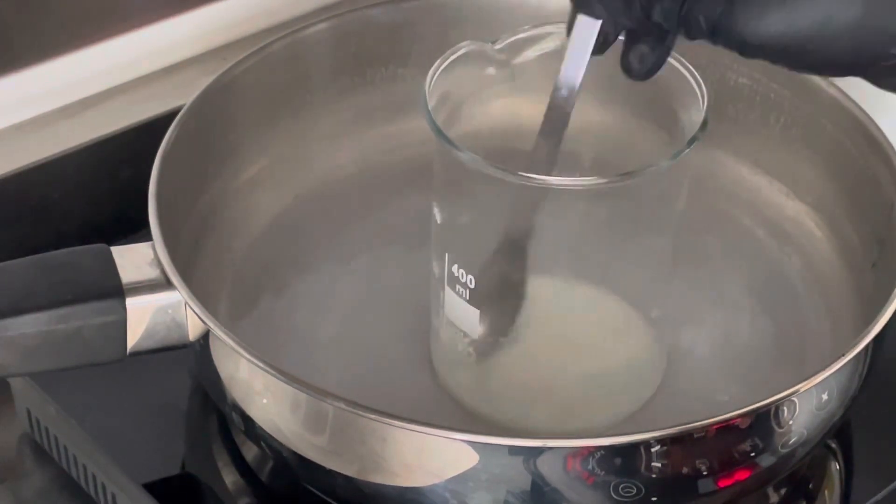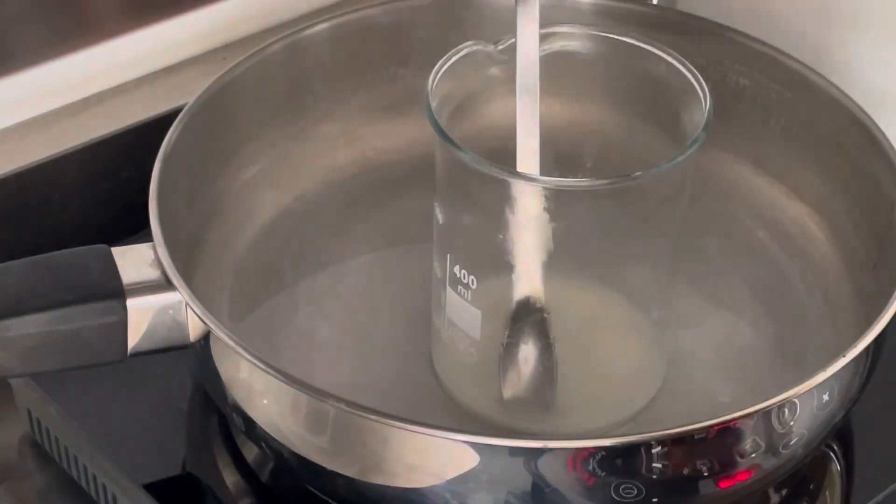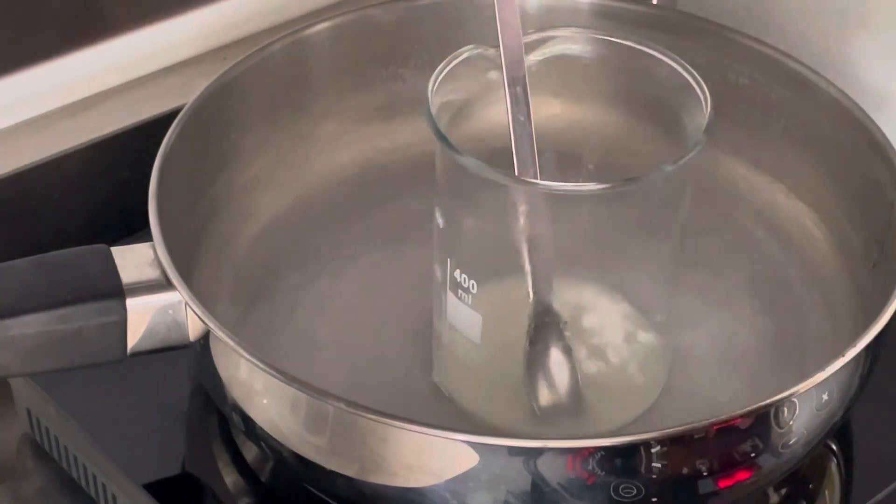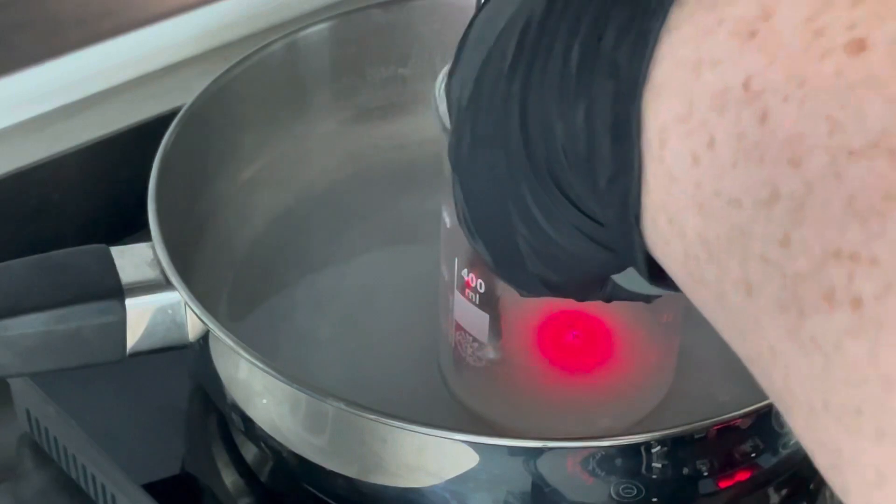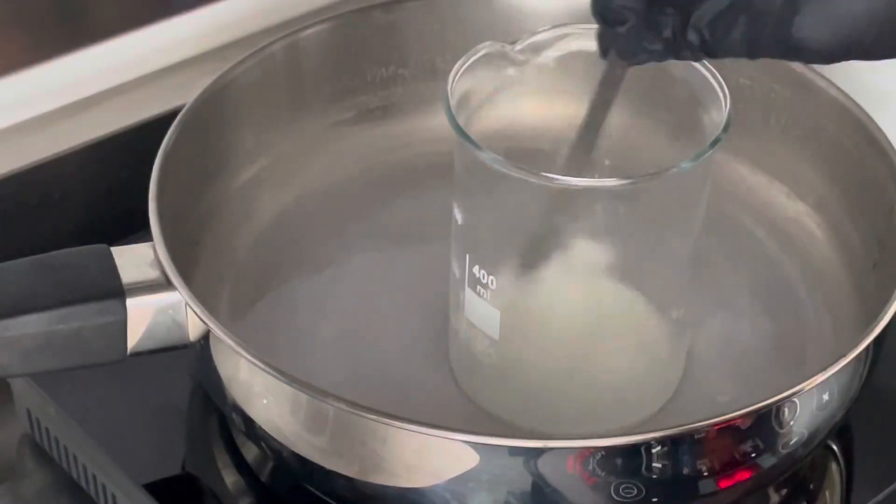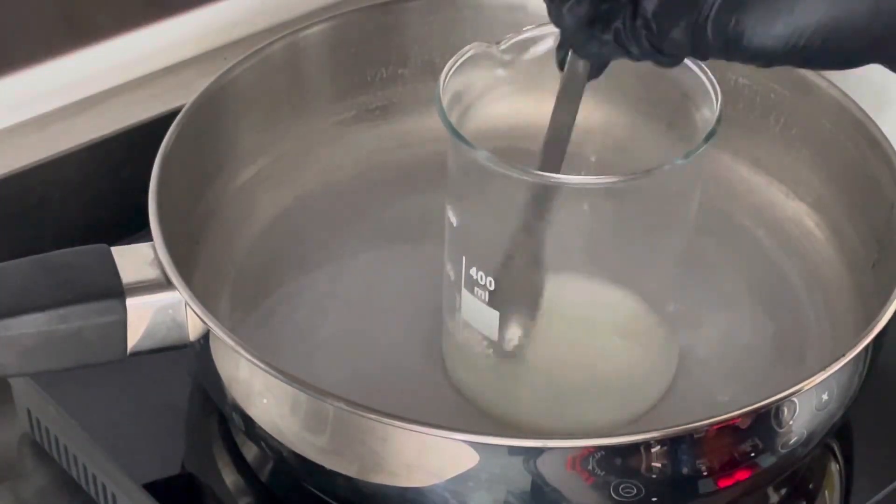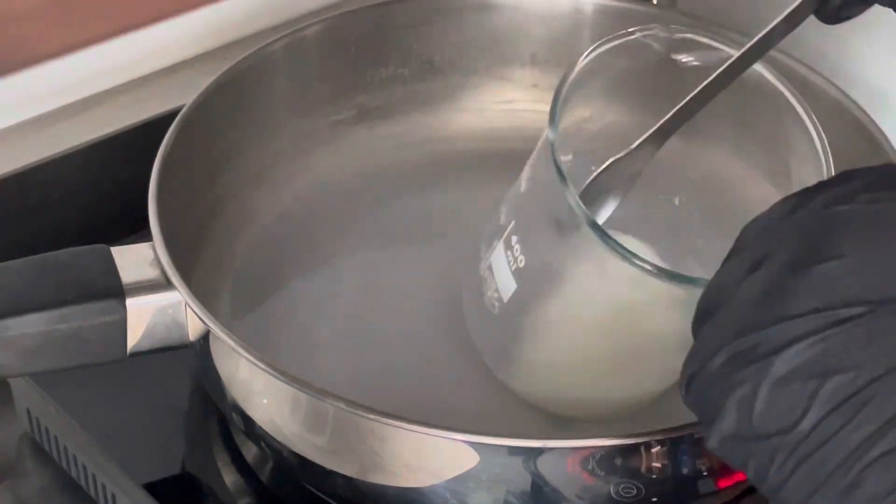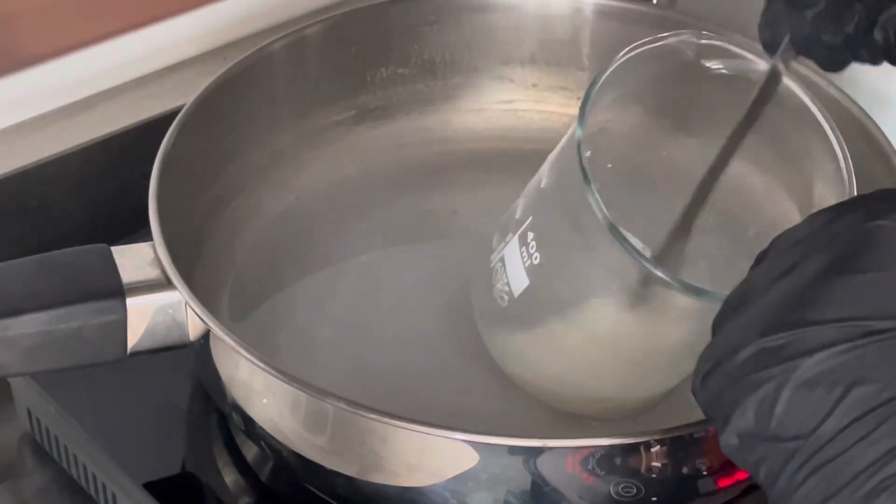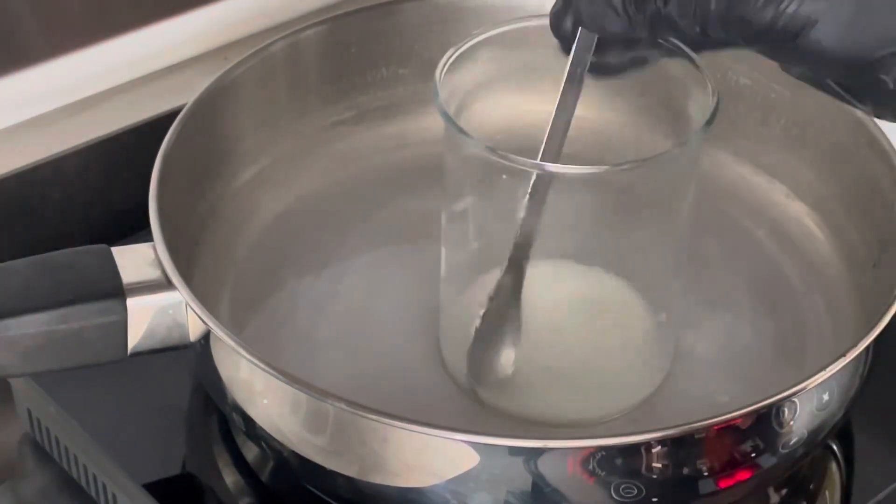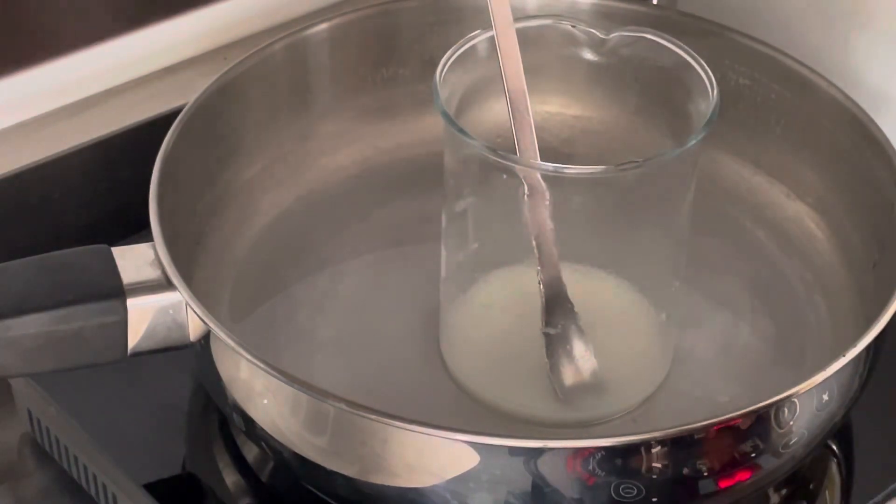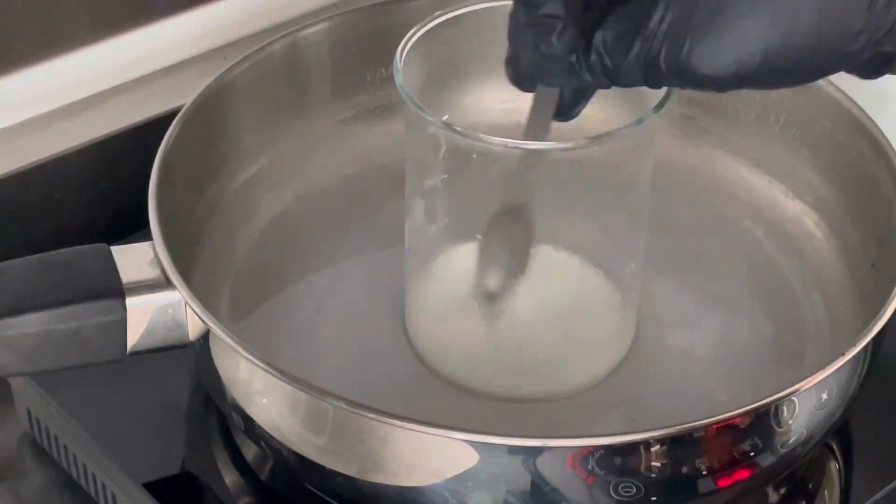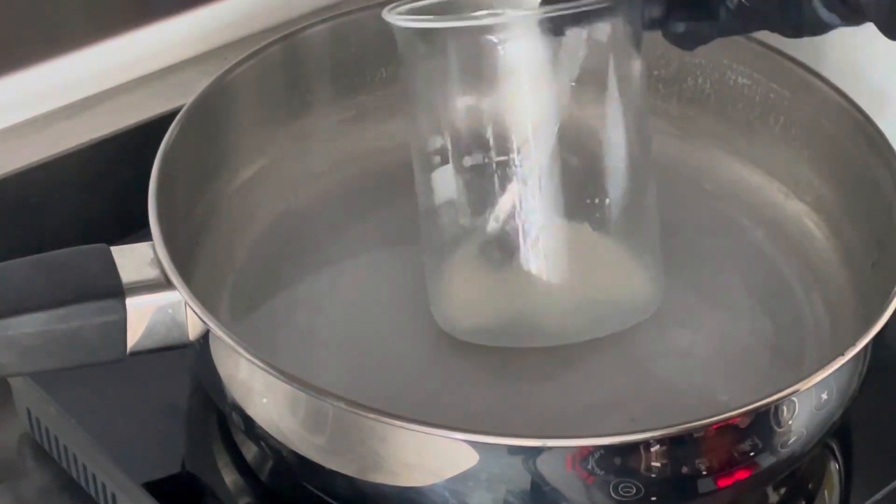Also if you are performing quite a few experiments do watch the water in your water bath because when I was doing this I realized it had all but evaporated away at this point. So I heated a bit more water to add to the water bath whilst I was working because I didn't want to add cold water to it because it would bring the temperature down, so I needed to heat that up and add a little bit more just to keep that going.